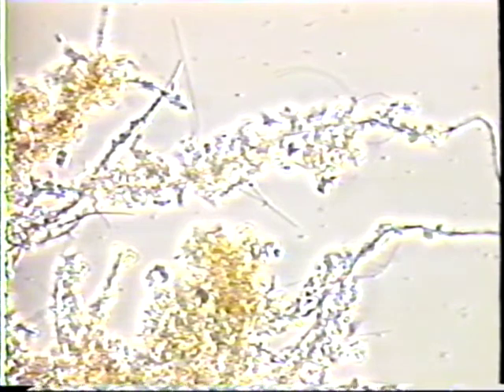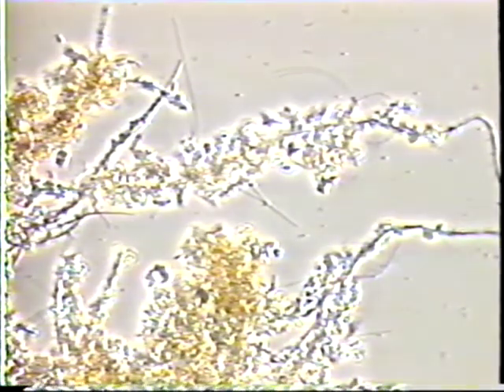Type 0961 is straight or smoothly curved and causes interfloc bridging. Type 0961 has long rectangular-shaped cells that appear transparent. Due to this transparent quality, it is often referred to as the cellophane tape filament. It is Gram-negative and Neisser-negative.